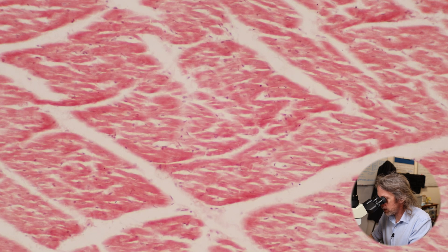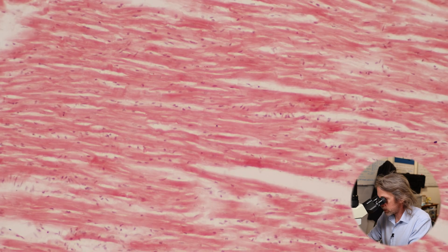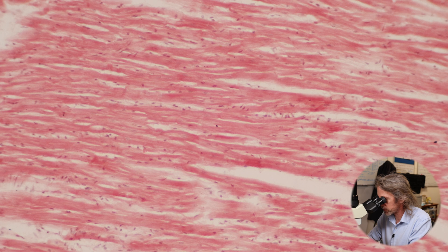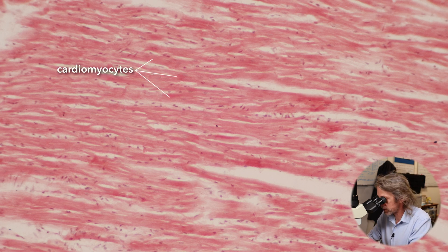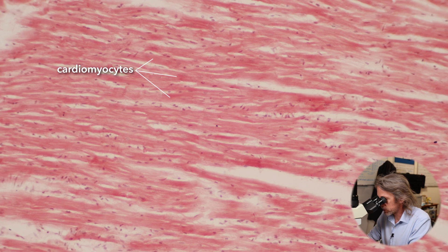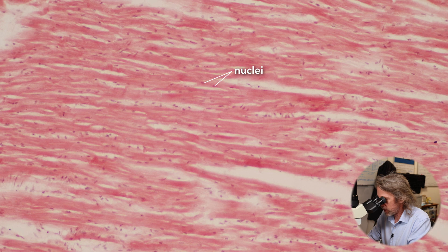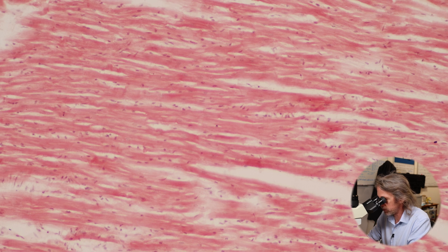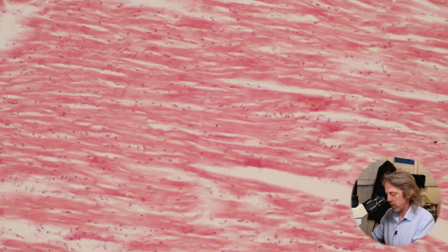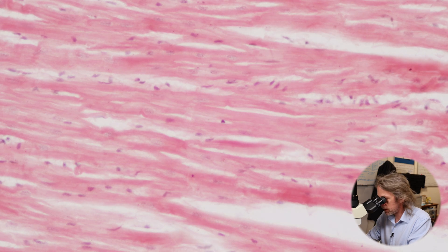At 10x objective, we can see cardiac muscle cells running from left to right across the screen. Cardiac muscle cells are called cardiomyocytes. We can see lots of nuclei and lots of red fibers running along — the red fibers are the contractile elements within the muscle that have been stained. This looks rather similar to skeletal muscle, so let's jump up to higher power.